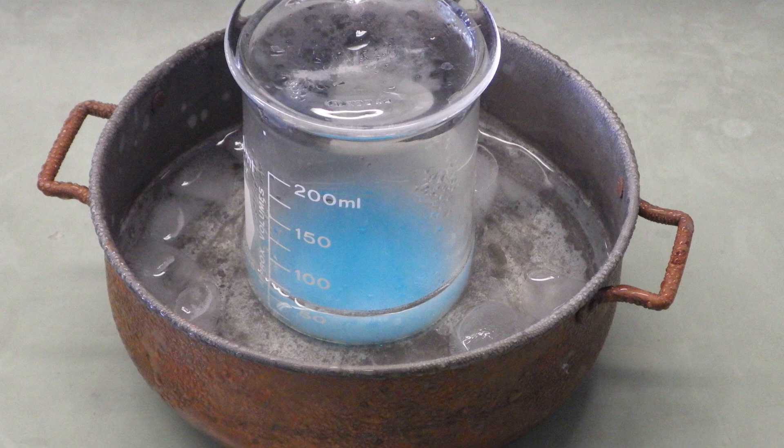That's simply to maximize the amount of salicylic acid that we can crystallize from solution. In fact, you can see it's not a true solution—there's solids present below the supernatant blue CSP. We can see white solids.